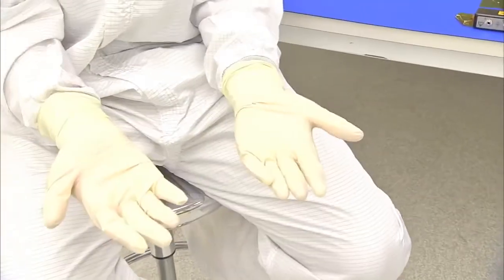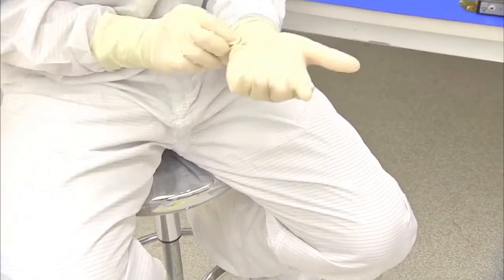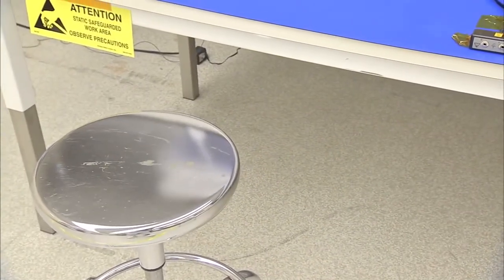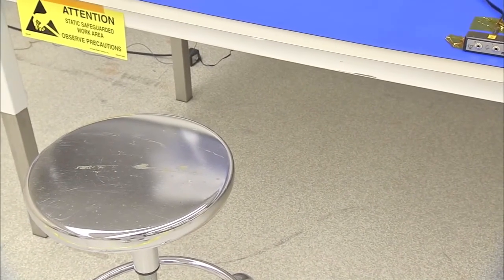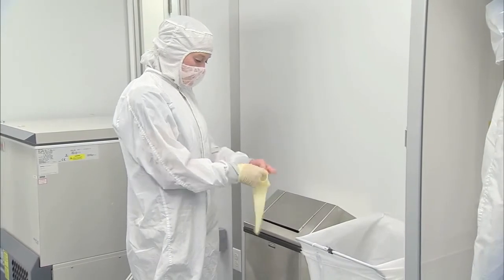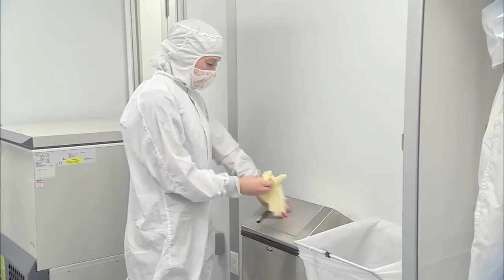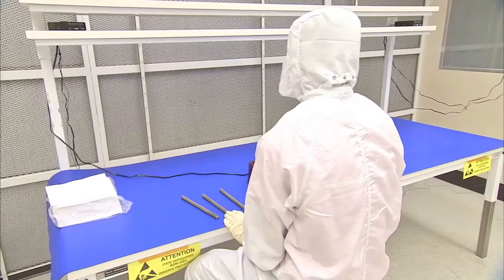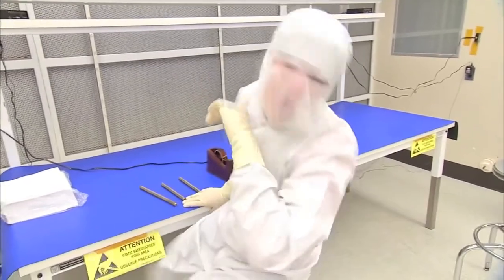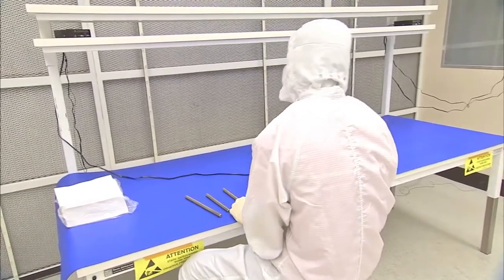Be sure to check your gloves regularly for any rips, tears, or contamination. If your gloves are damaged or contaminated, exit the cleanroom and change out of your gloves in the gowning room. Your skin can introduce large quantities of contamination, so properly covering your hands is essential for protecting the hardware. If you have to sneeze or cough, be sure to do it facing away from the equipment. Do not cough or sneeze onto your gloves.